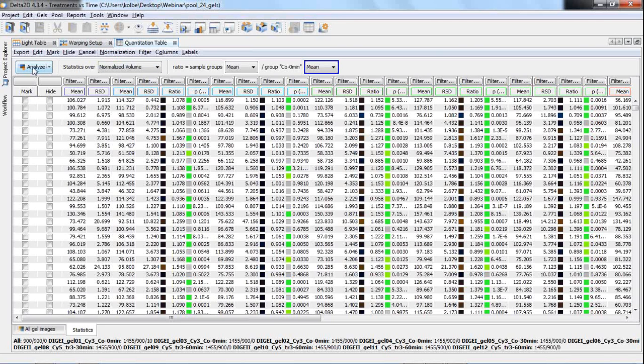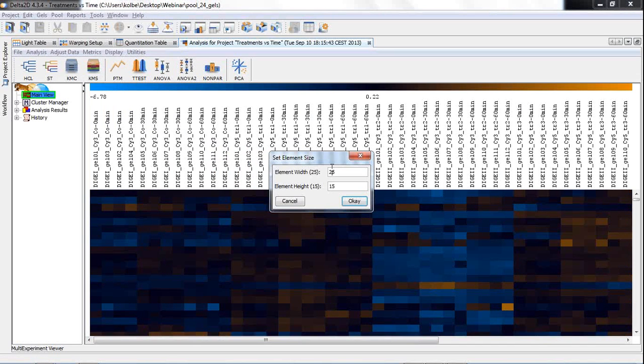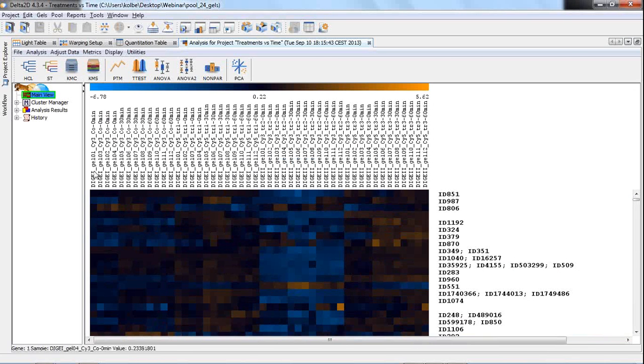Having these complete expression profiles, we can then press this Analyze button, and then the data is standardized. In case of multiplex experiments, it's logarithmized also, and then the statistics window is appearing. Just a second, it takes a moment to transfer the data to this window. Now let me first change a certain parameter, because otherwise it does not fit on my screen. Here we go. Now we have 48 images forming 48 columns, and each row is representing one expression profile, and the spot quantities are translated into colors. The color gradient is shown here on the top. It's ranging from -6 or 7 to +5 or 6, and high values are shown in orange, lower in blue, and the medium values are shown in black.